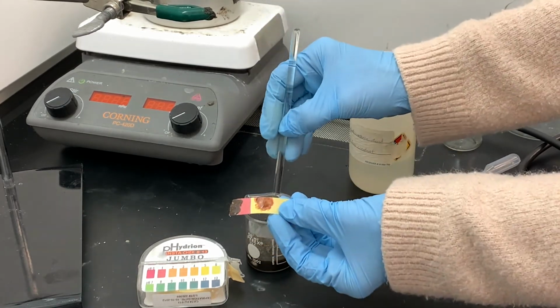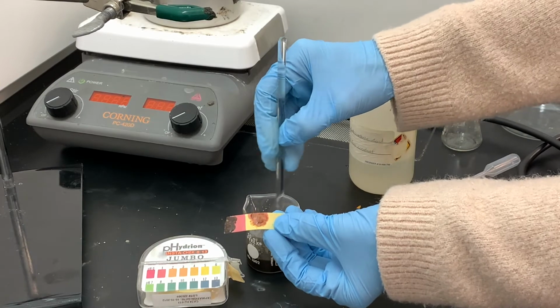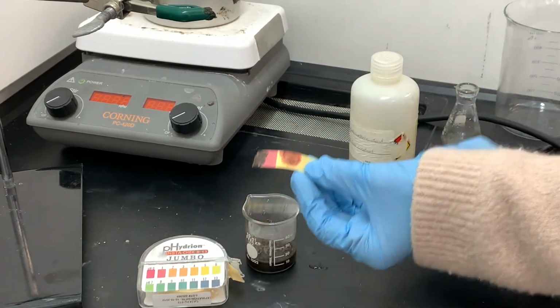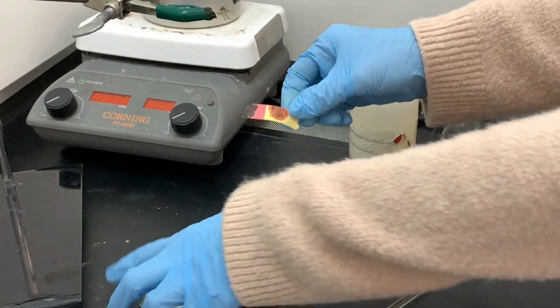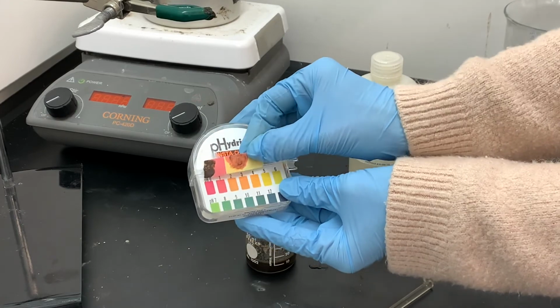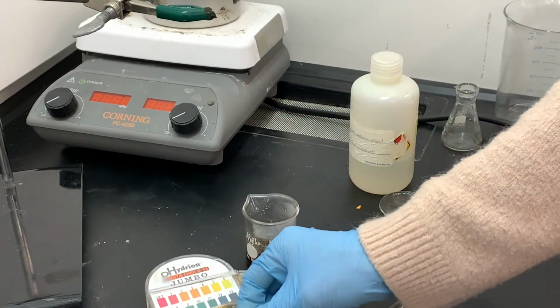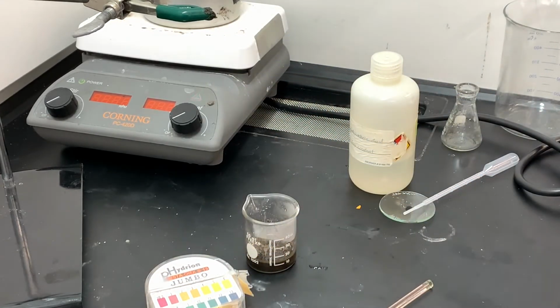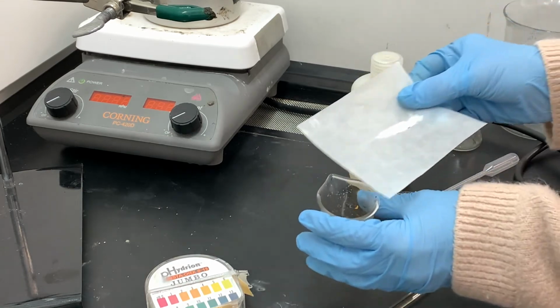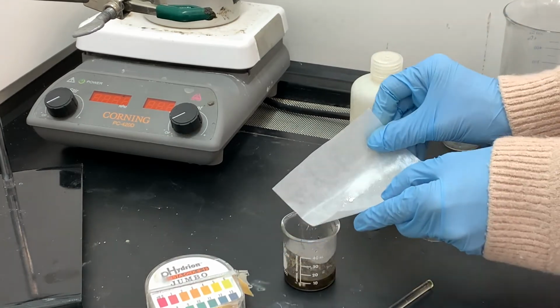And this is a hard pH to test because of the color of the solution, but it looks nice and pink, so the solution is still pretty acidic. Looks like it's around 1 or 2. The brown color did not disappear, so that means I just need to keep adding more of the sodium bisulfite. So here comes another one of the portions.